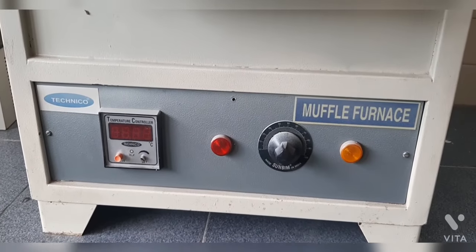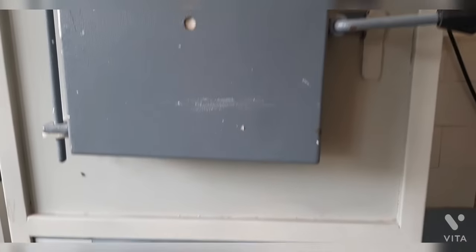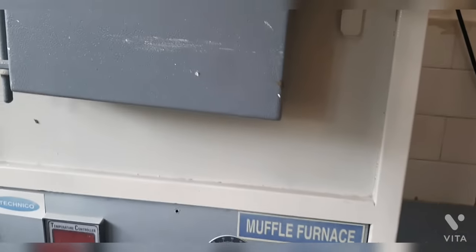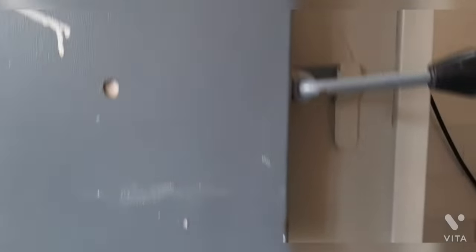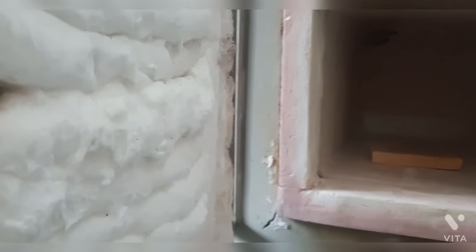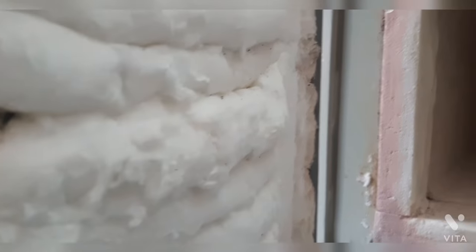In this video I am going to explain all about the determination of porosity of a refractory. Refractories are materials that can withstand very high temperatures. What I am showing here is a muffle furnace which is lined by means of alumina refractory.